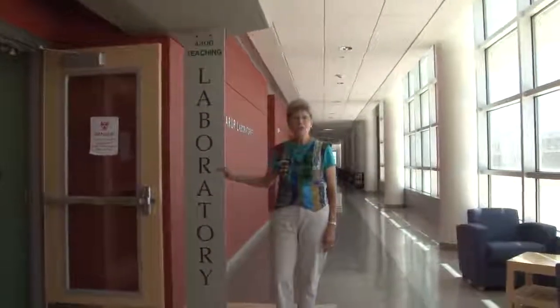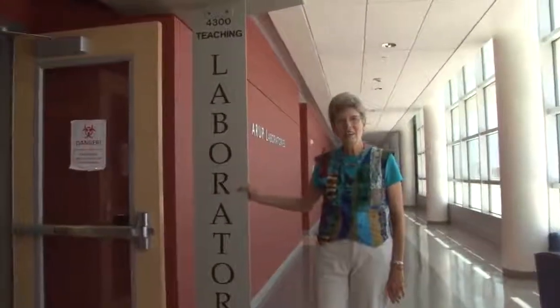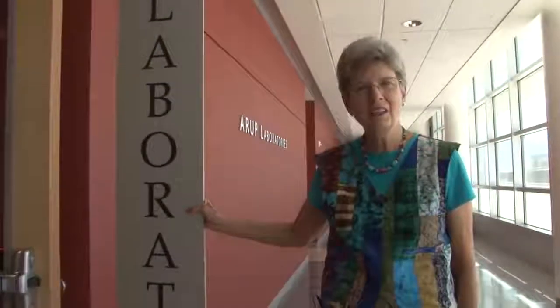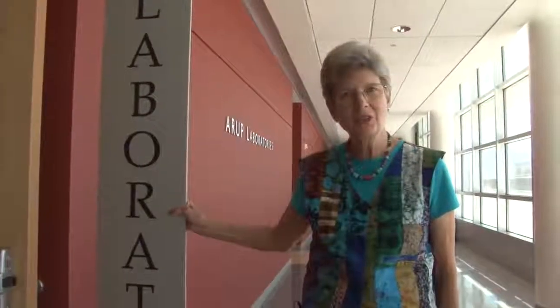Welcome to the University of Utah Neuroanatomy Laboratory. We're going to go inside and do some dissections of the brain and look at some of the important structures that are useful for understanding neurological principles and localization.